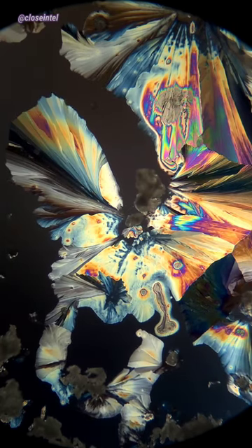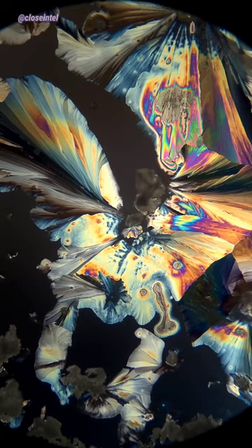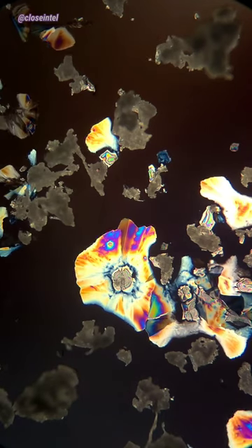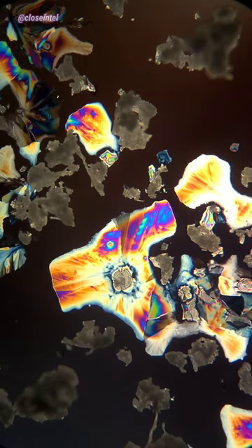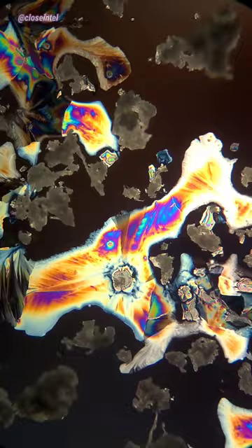This whole process took a lot longer than the ascorbic acid video that I made. They all had their own unique pattern just like before too, and it was pretty mesmerizing to watch.